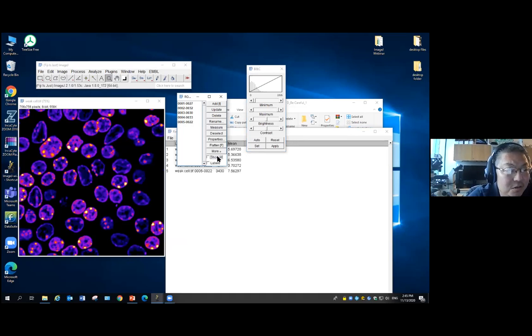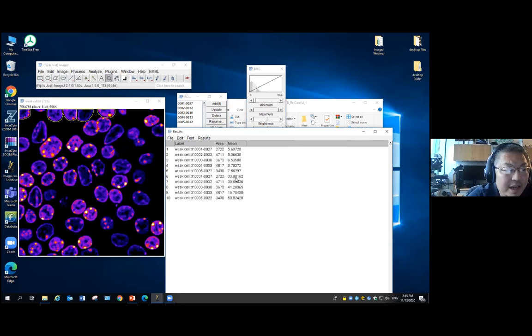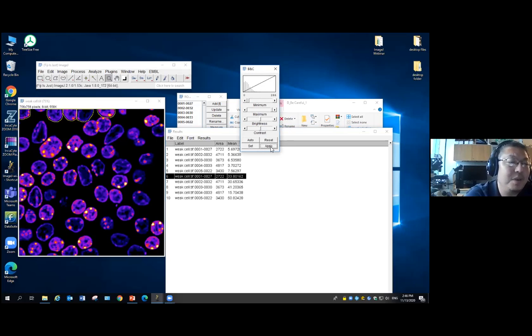Now I go through all this file. I do the measure. You can see the intensity goes way up. Compare number 1 and number 6, which are the same cell. They're the same size, but you can see the intensity changes. That's because you clicked apply.